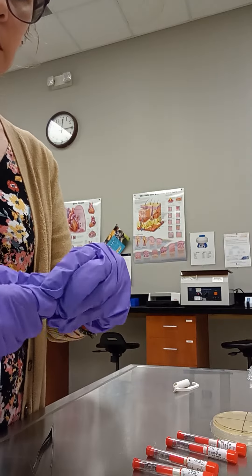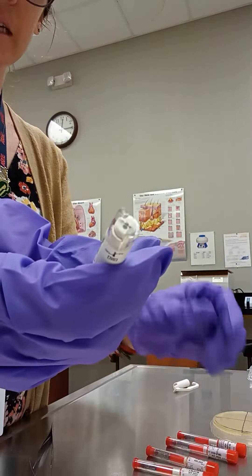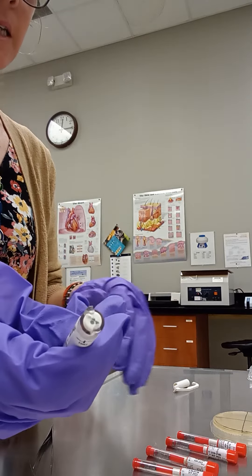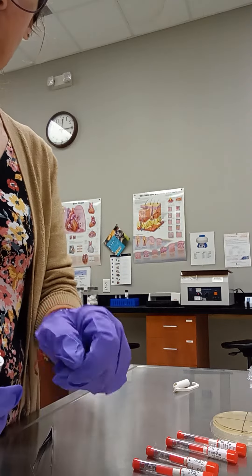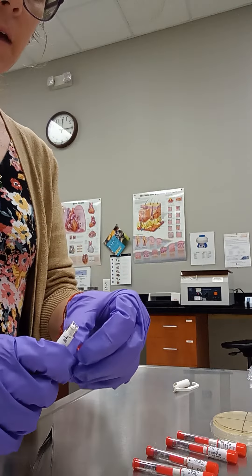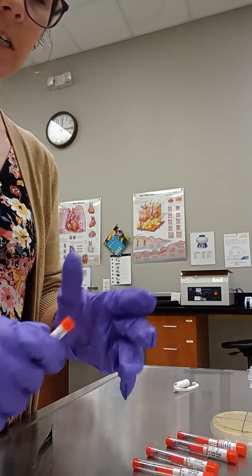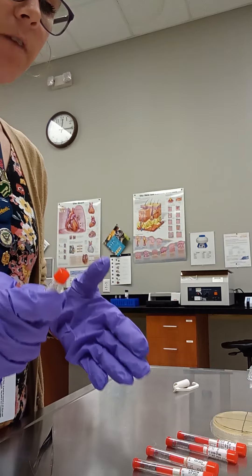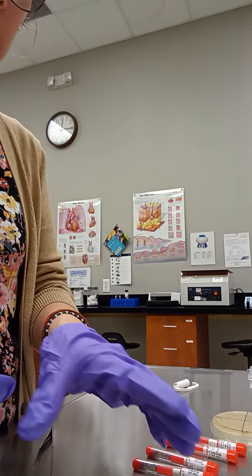These little containers are full of tiny paper discs, and each of these paper discs are impregnated with that antibiotic. We're going to place them onto the plates in different areas across the agar, and then we'll be able to come back and measure our zone of inhibition to see which of these five antibiotics is going to kill the bacillus the best.